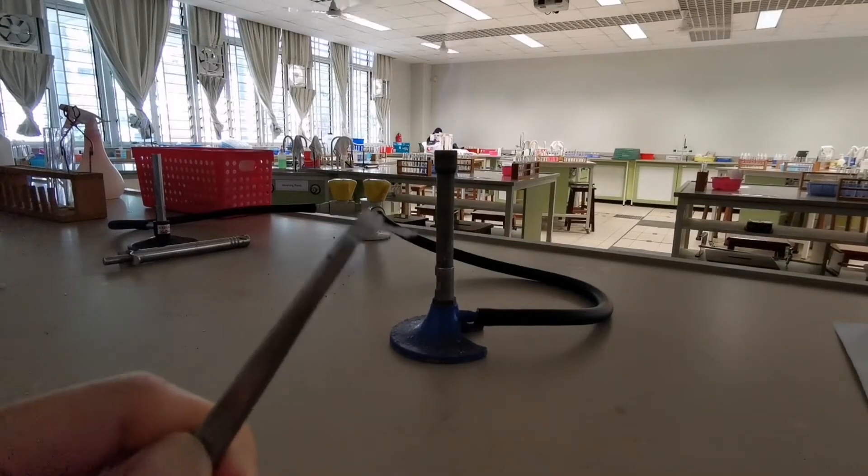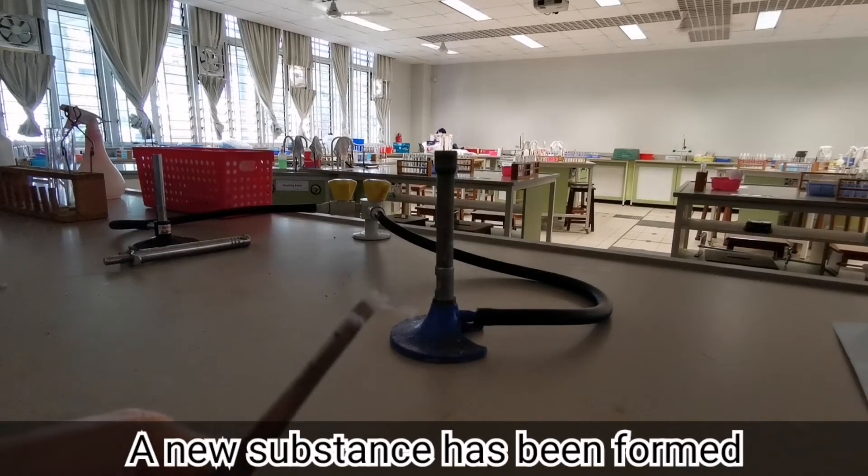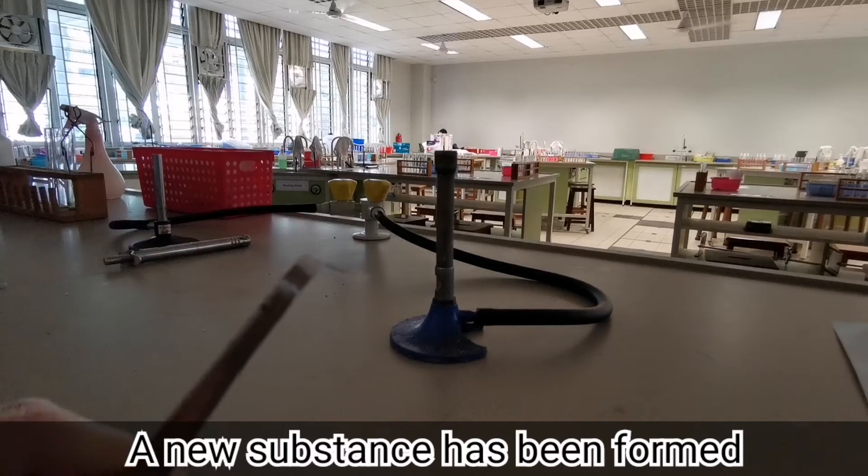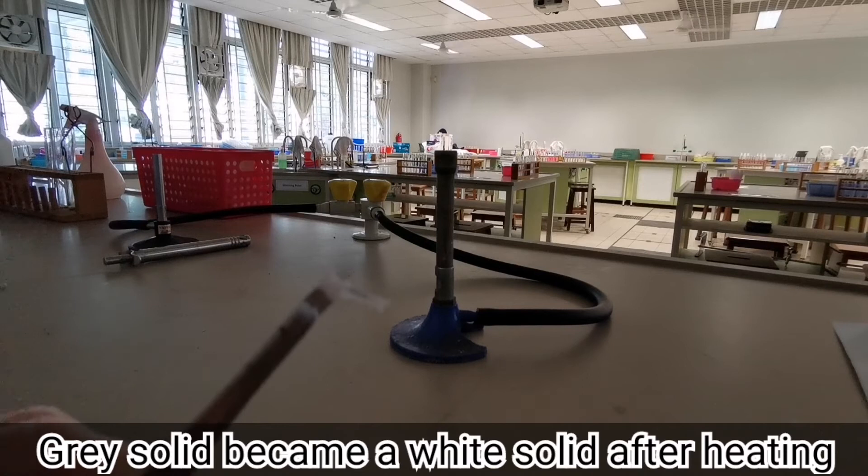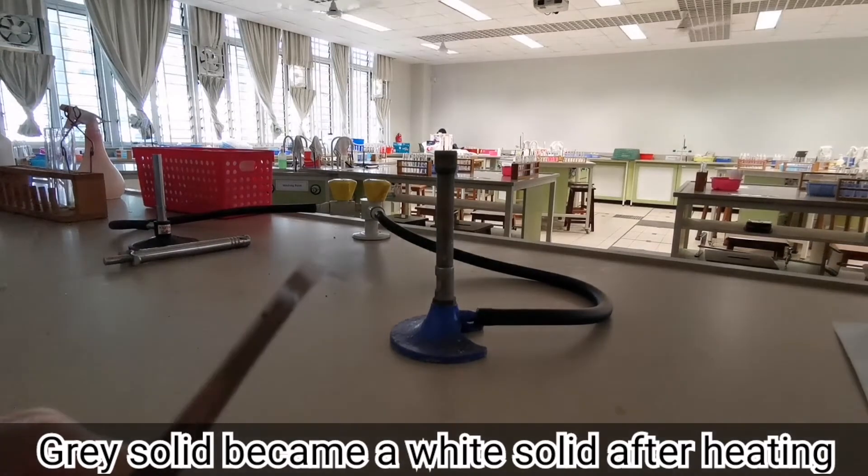And at the end of the reaction, we can see that a new substance has been formed as the originally grey solid, which was the magnesium metal, has now formed a white solid after the reaction.